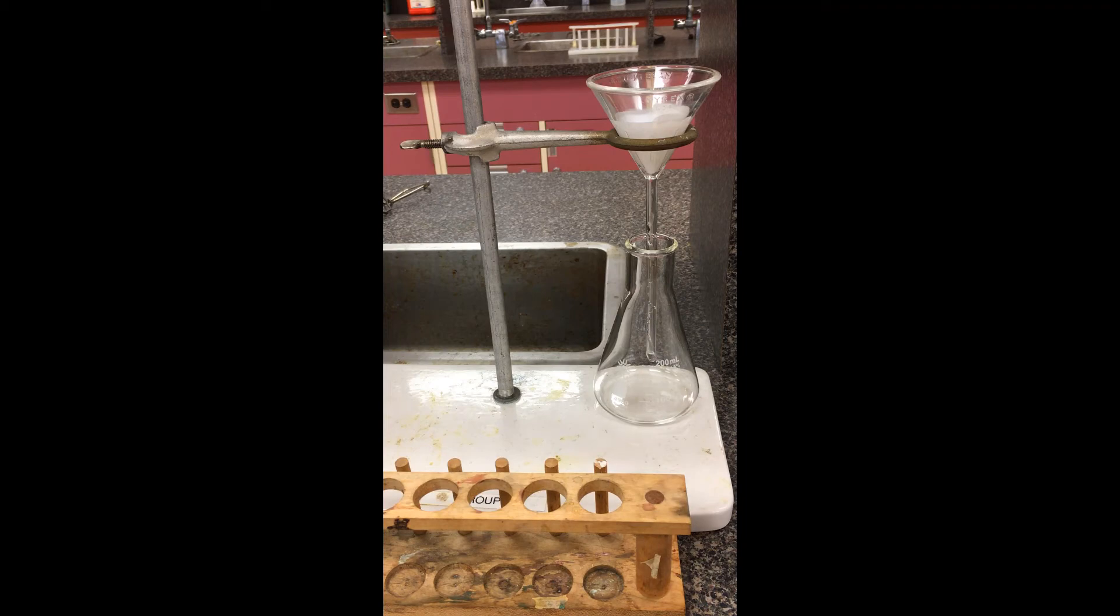We've separated this based on the different sizes. So the solid couldn't get through the filter paper, while the water, in this case the filtrate, had no problem getting through. Thanks guys.